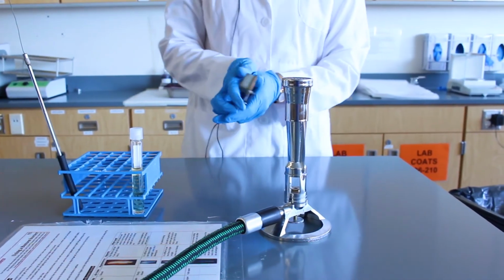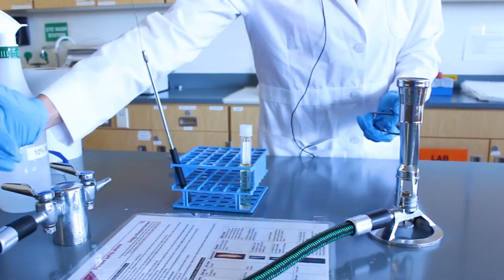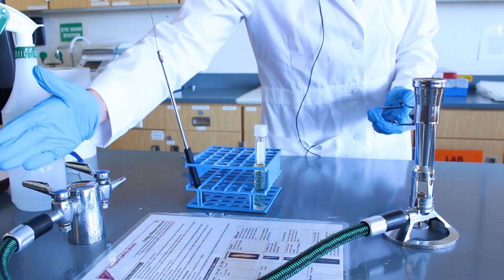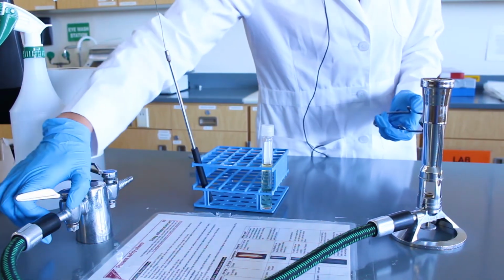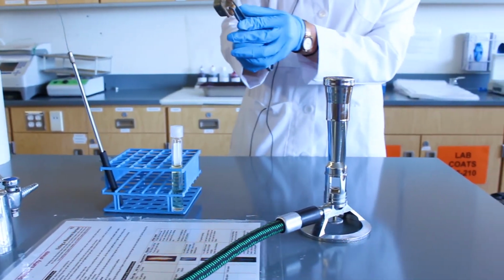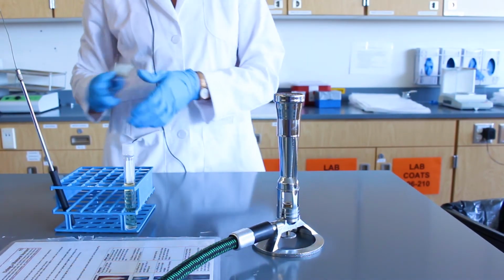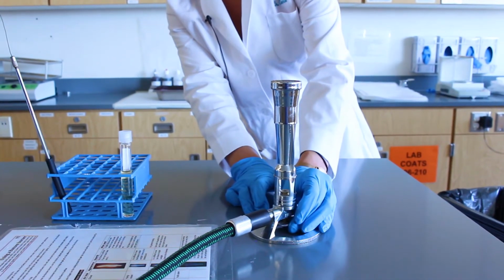Before beginning, turn on your Bunsen burner. When the valve is facing up and down this way, the gas is closed. So it's closed like this, and it is closed like this. Whenever the valve is facing in this direction, it is open. When you open the valve, you should hear gas escaping. You will use your striker to press down. If you need to release more gas, you can use this bottom knob, turn it right and left.